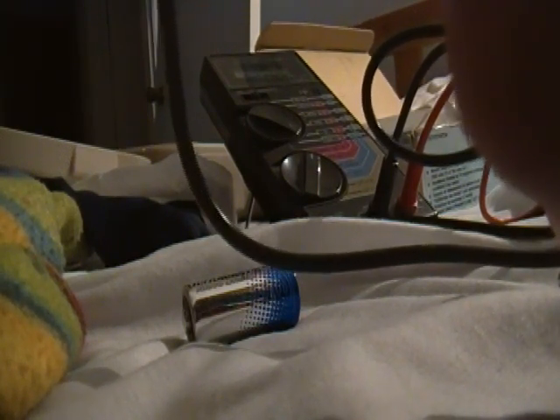Okay, I'm now going to check to see if the battery is not the problem using my handy Conta multimeter here. Look at that. I am showing negative voltage here. Negative 0.52 volts. So let's check it on the 30 volt setting. Make sure that I'm not blowing something here. So we are receiving negative voltages. There is something wrong there.